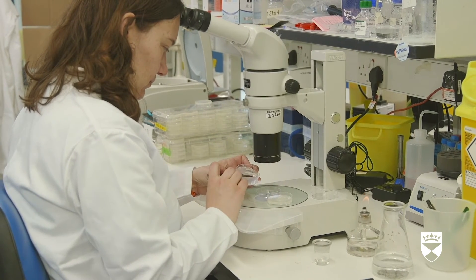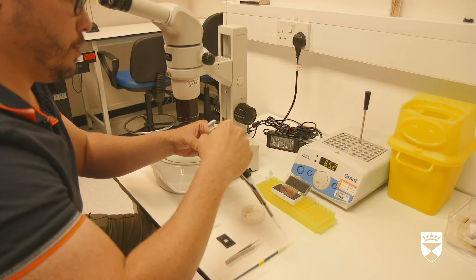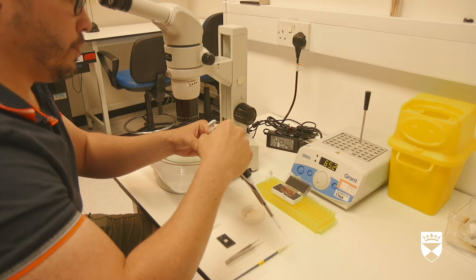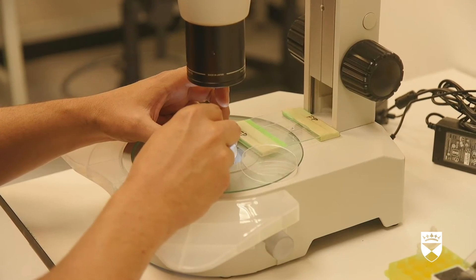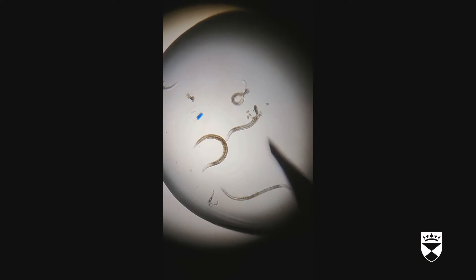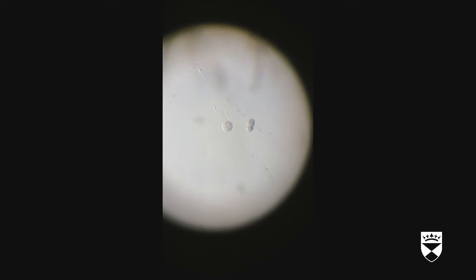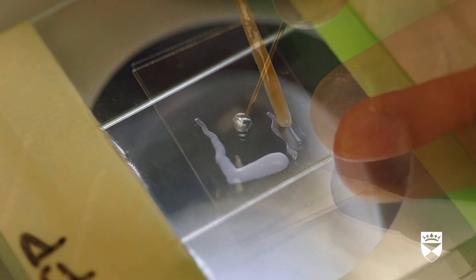Let's get back to our research and what we use the worms for. Another scientist studies an agar plate under a microscope, and footage shows worms and eggs on the plate. We use a specific type of cell, the oocyte, from the worm in our experiments. Oocytes become an egg through a process called gamete formation, which is exactly the process that we study. It is important for all sexually reproducing organisms to make sperm and egg cells, collectively called gametes, which will then fuse to form an embryo.